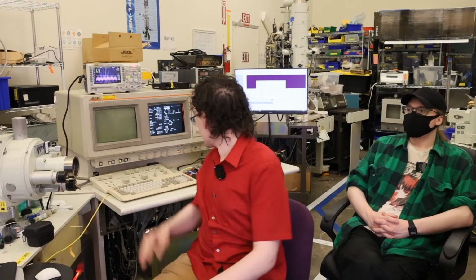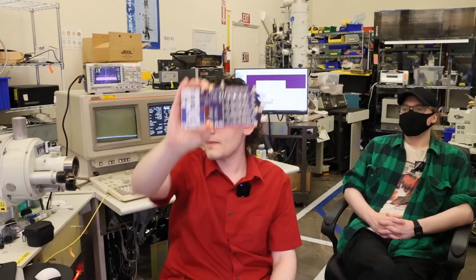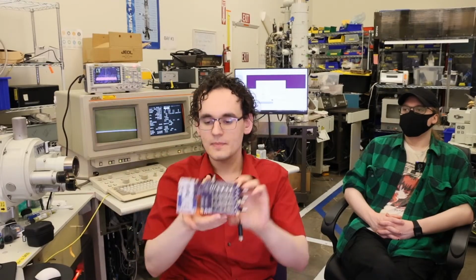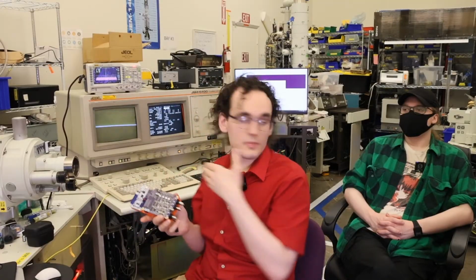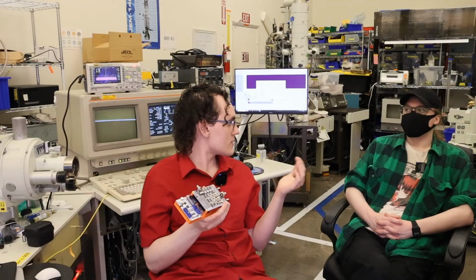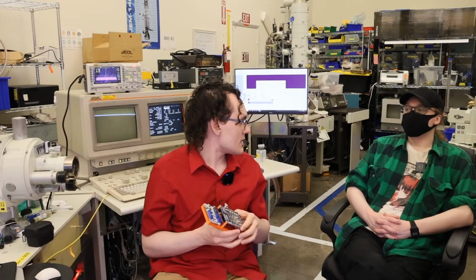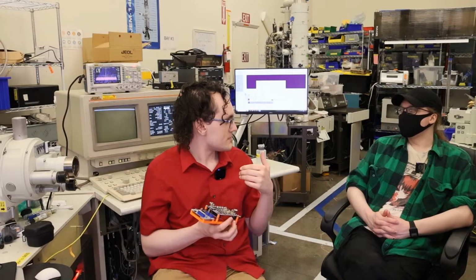So we're going to start with the open beam interface. This little cable is for flipping a relay inside of the SEM. We are going to be installing the software on the computer and putting the open beam interface on the SEM, and then we're going to use this to do our imaging of our metal. Feel free to ask any questions as we do this. Do you want to start with software or hardware? Software probably. Yeah, let's start with software. That sounds good.